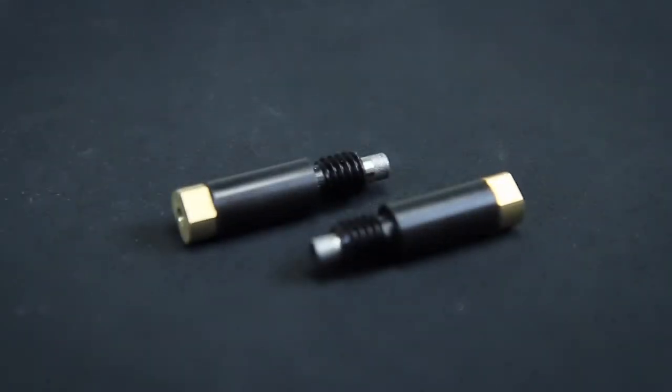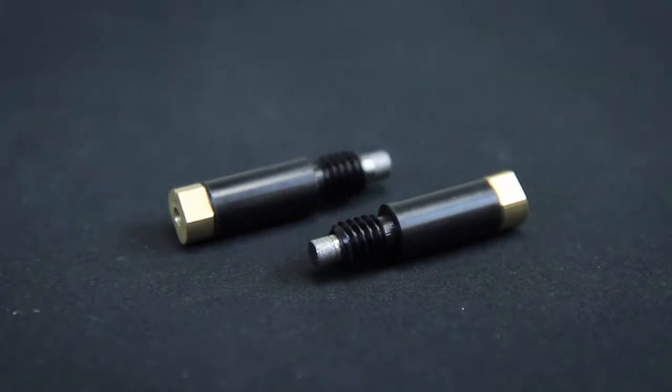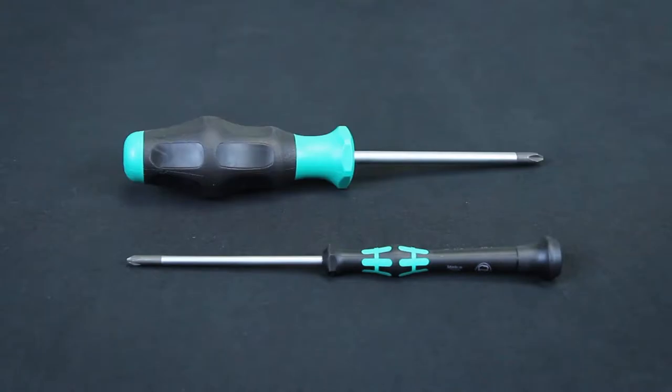When changing the brushes, you'll want to work on a clean flat surface. Additionally, you will need a small and large Phillips head screwdriver, which can be purchased as part of our Wave Vortex Accessories Kit.